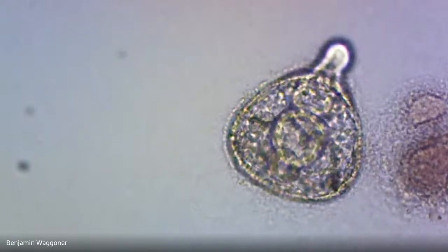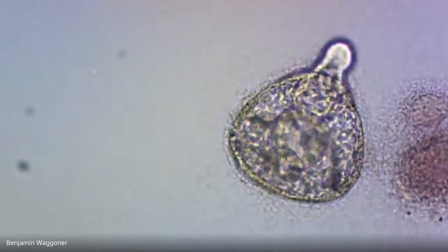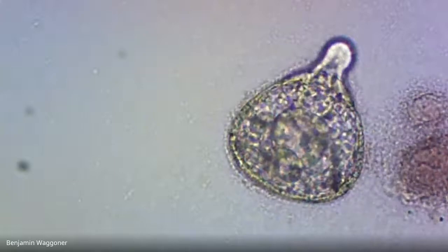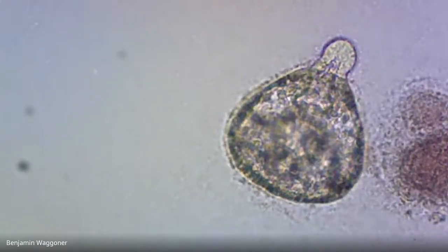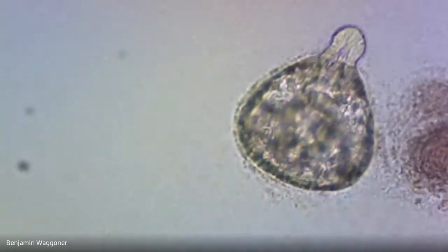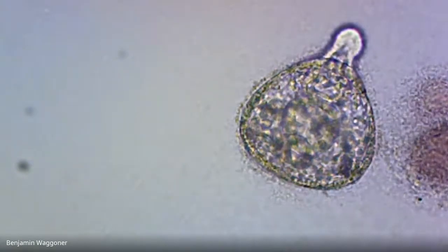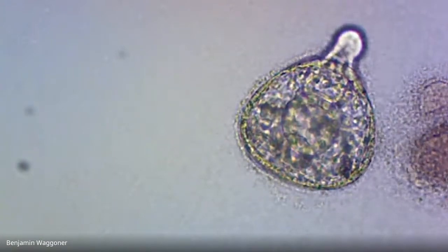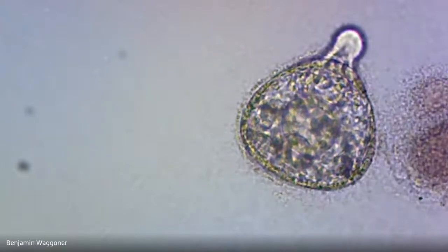And again, the shape is no longer really round. This would also be a prism larva. However, it does have something sticking out in front of it, and I'm not sure what that is. That's not a normal prism larva. I'm not sure whether that's because of the nickel or because it's gotten bacterized. We have the problem that the bacteria are going to mess with things as well.